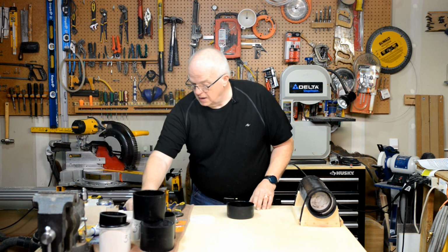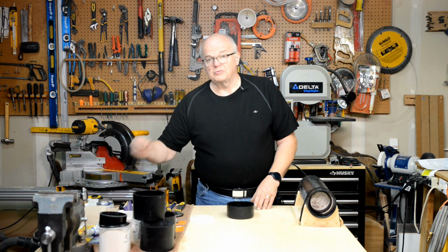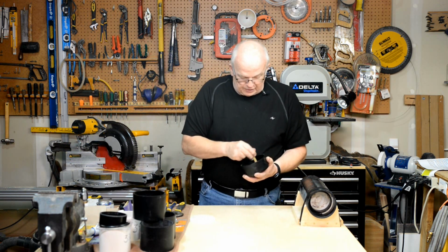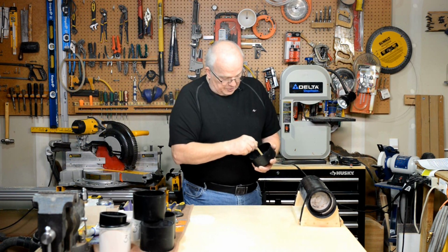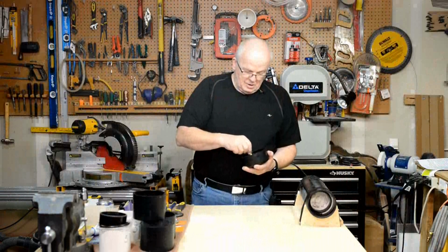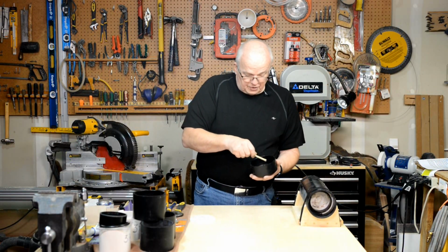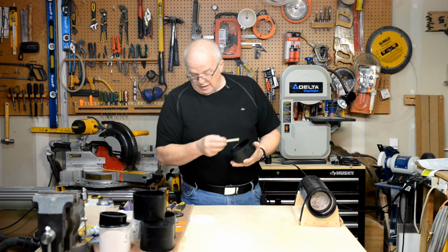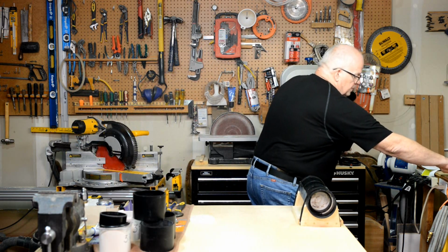Now, take one of your chopsticks, piece of stick, popsicle stick, whatever you want, and mix that around in there. So I'm going to mix it for about a minute. I'll be back in a minute. Okay, it's been about a minute. It's well mixed. I've got it completely covering the bottom of that cap. And now let me set this aside here.